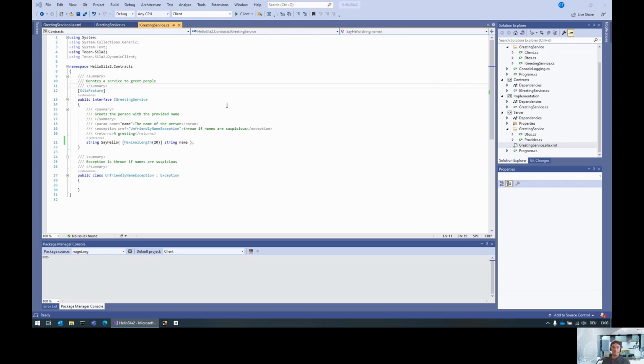In the previous videos, I already created a small, simple server with a greeting service. In this video, we'll extend this to make use of lists and data structures. The first thing, once again, is the contracts that we need to adjust, because the contracts describe the interface that we expose.